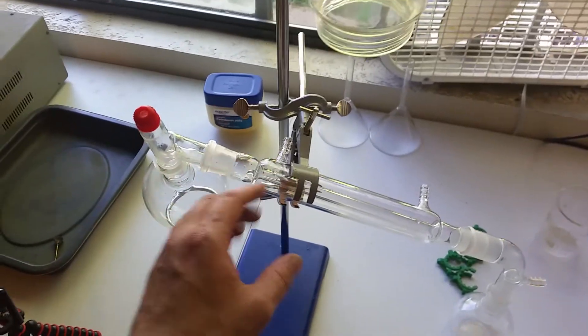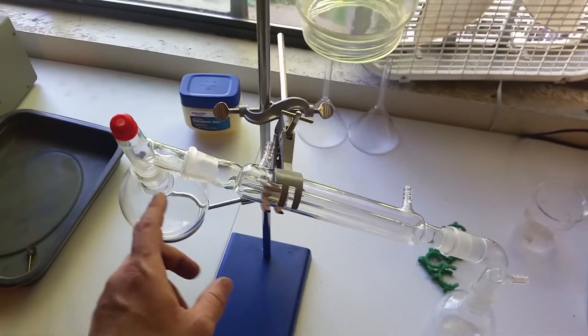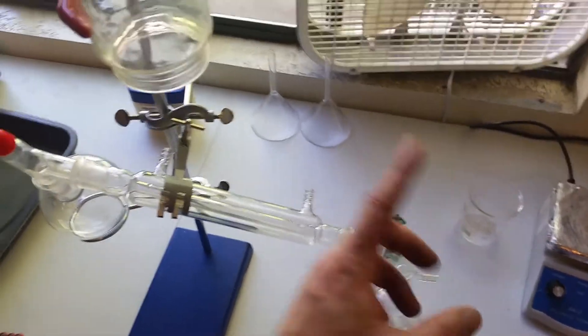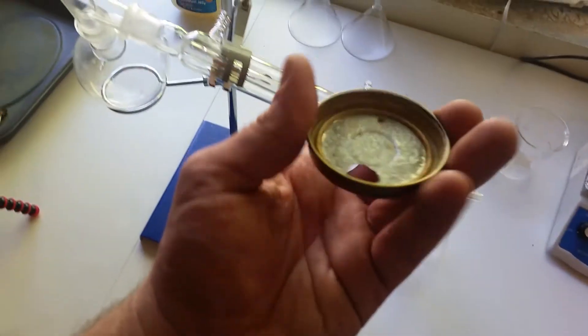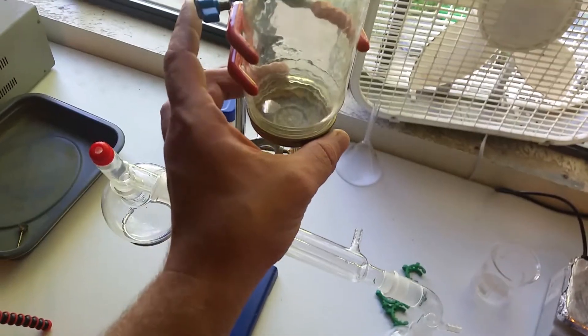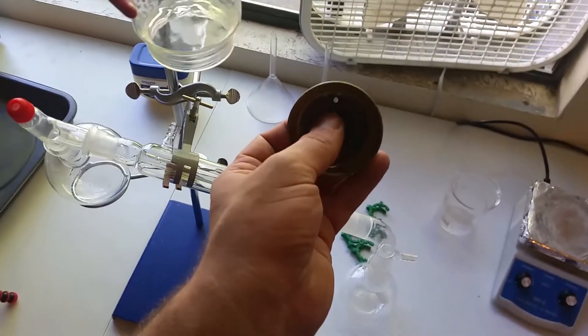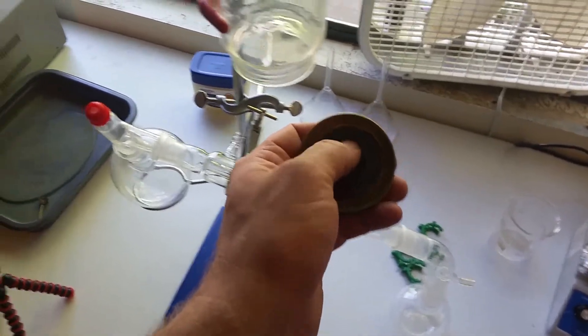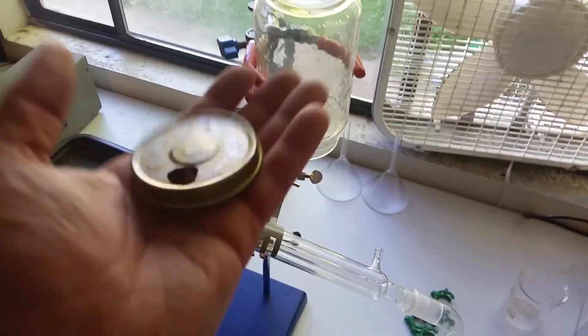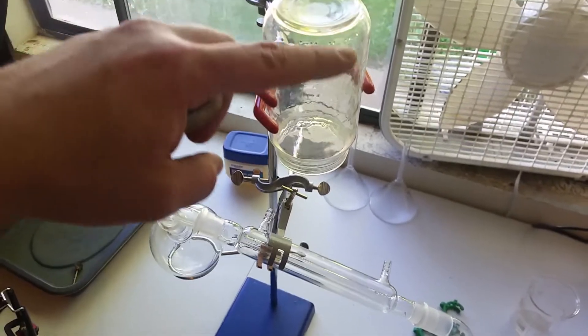The reason why I have it coming through a distillation chamber is because this produces an awful lot of water vapor, and I'm hoping to condense a lot of it before we collect the hydrogen. This cap has got a big hole for the hose to come from here and go up in there. There's a smaller hole as well. This is to let the heavier atmospheric gases leak out of the jar as the hydrogen rises to the top and fills it from the top down.